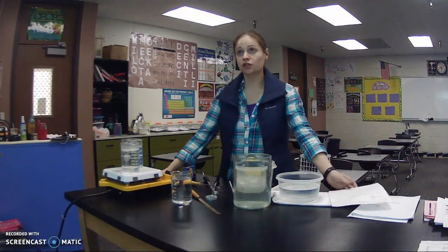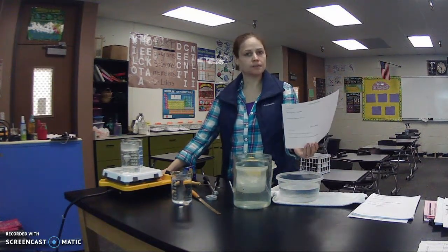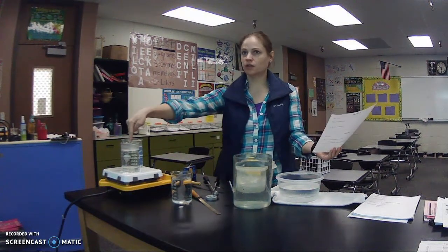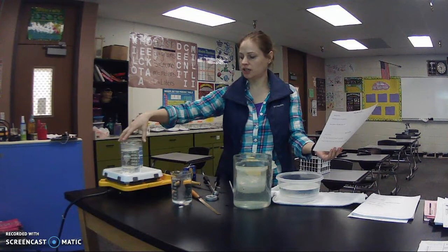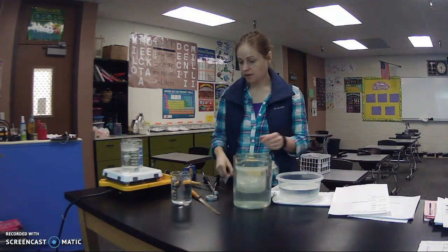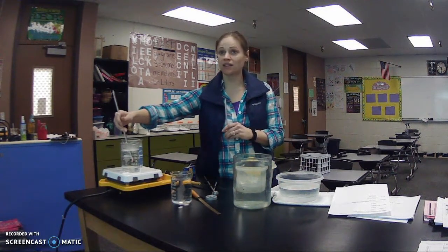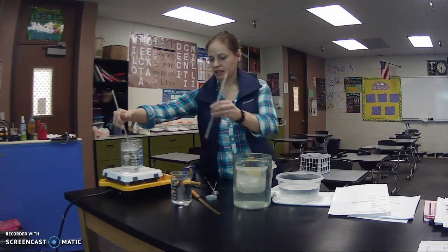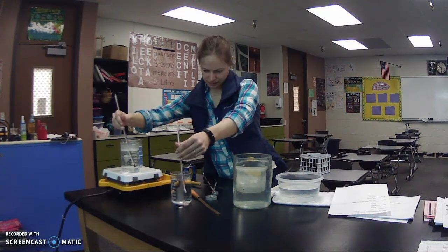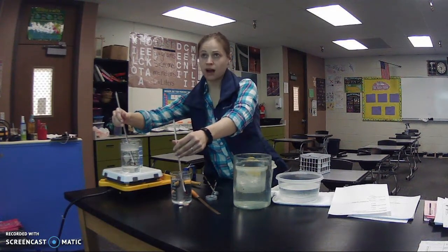On the move demonstrations. Okay, I'm just going to go through these very quickly. Our first one, food coloring in water. This is beaker A right here, and this will be beaker B. They are vastly different in temperature. This one's been on a burner for a while, so beaker A is 70 degrees and rising. Beaker B is around 20 degrees and dropping.